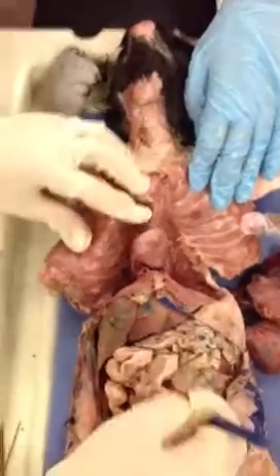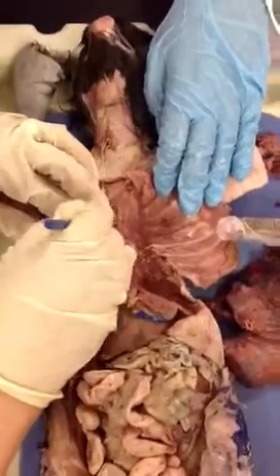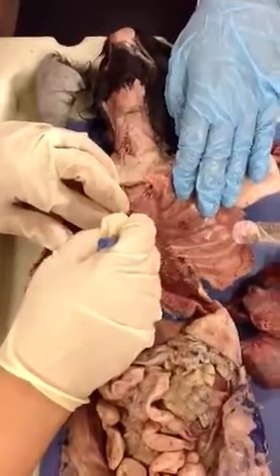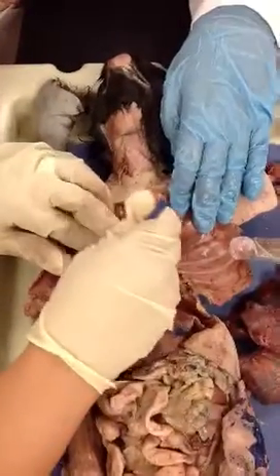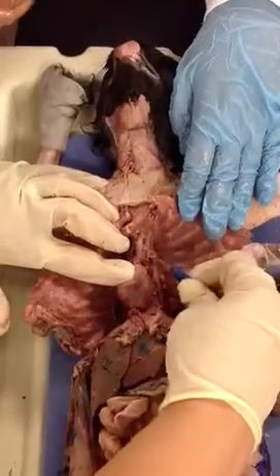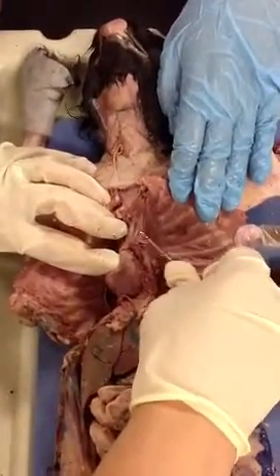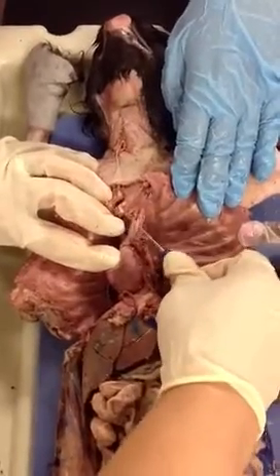That's good stuff, Jim. So the first branch of the aortic arch in the cat, which one is it? Brachiocephalic. And the second branch, which one is it? Left subclavian. Very good. So here we see clearly our first branch. You see it? So this one is what? Brachiocephalic. Very good. So this is my brachiocephalic. And then here, my left subclavian. You see it? Very good.